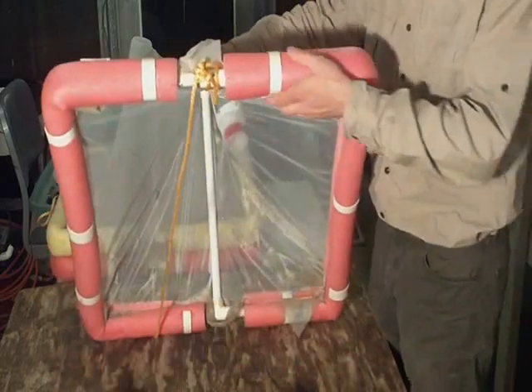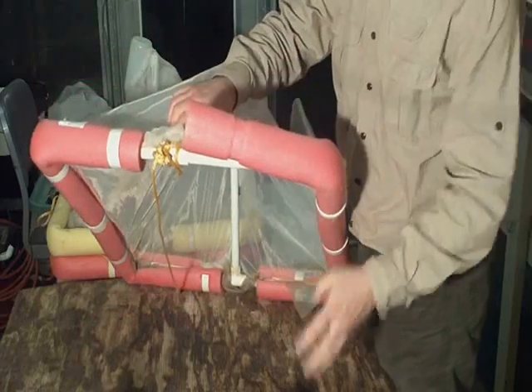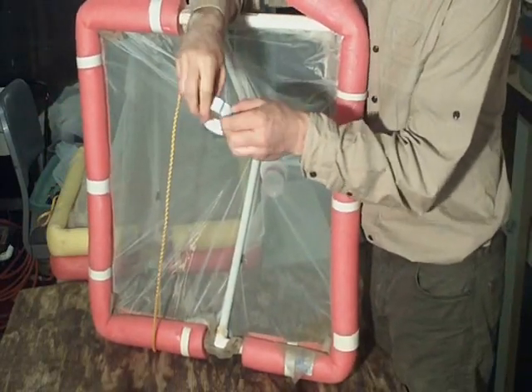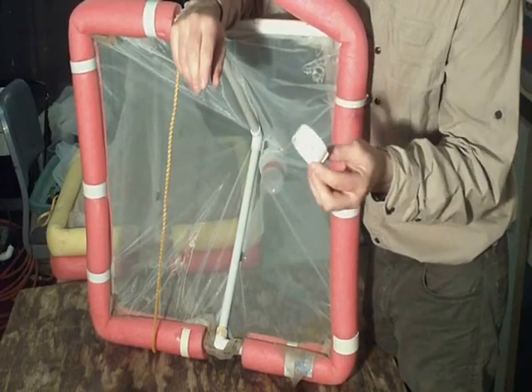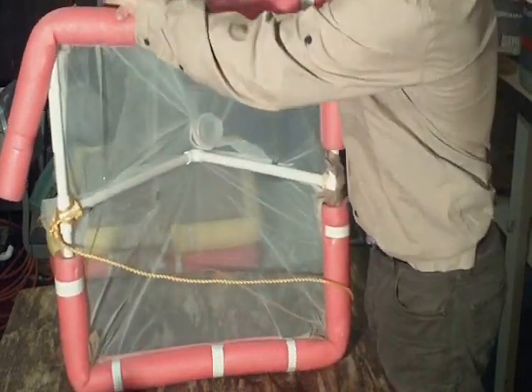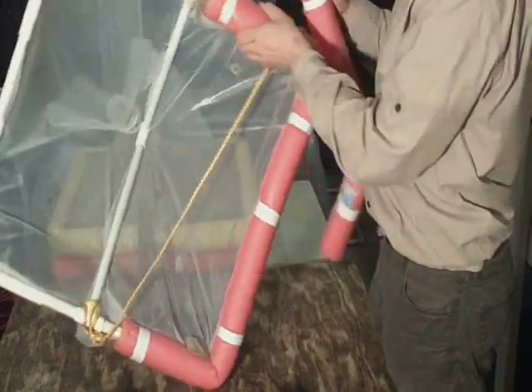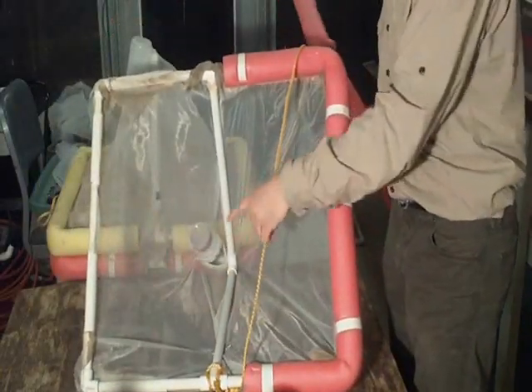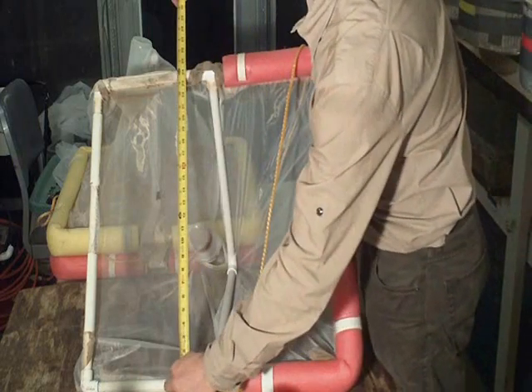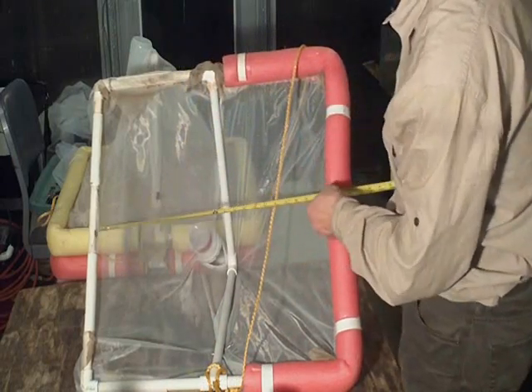As for the flotation here, as you can tell, this is just a fun noodle, a little kid's fun noodle, and we split it lengthwise. And then we just took some PVC and split it into clips, right? So these clips you can get, you know, a foot for 70 cents. So those things are cheap. And the fun noodles you can get for $1 at the dollar store, there's 2 of them, and they're the perfect length. We used the same size base as Kurt Fausch and Colvin Baxter and numerous other people. The inside dimension here looks to be 23.5 inches, same with there.